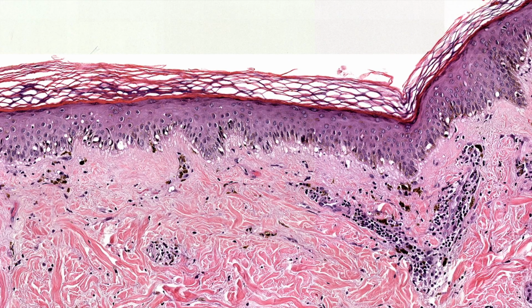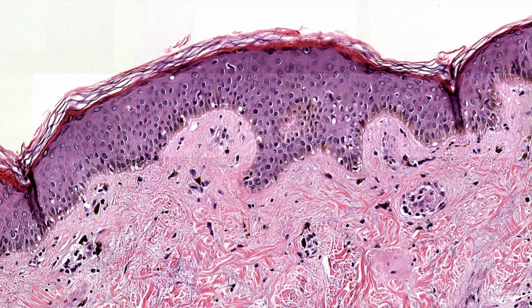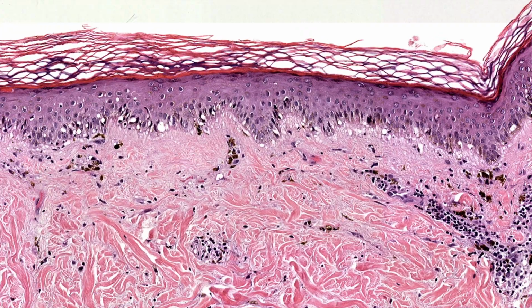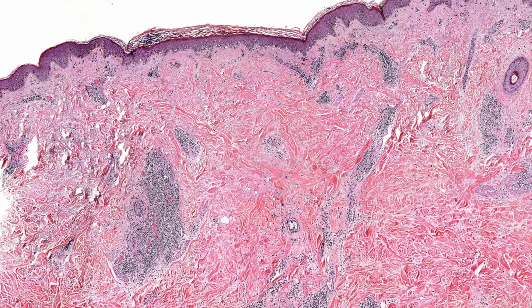But there are a lot of vacuoles, and this really ratty appearance as opposed to the more clean, sharp line of demarcation between the dermis and epidermis here, right? This is basically normal-ish. And then over here, we've got pretty decent vacuolar interface with pigment incontinence, which is another sign that we probably had interface. And there's one dead keratinocyte there. Okay, sorry, carry on. No, it's perfect.